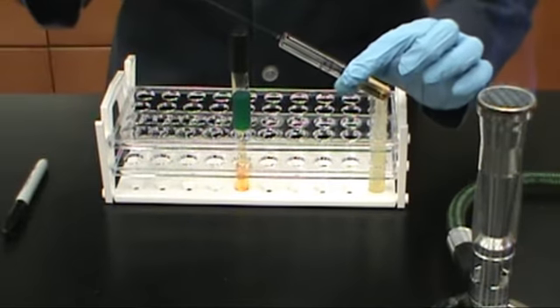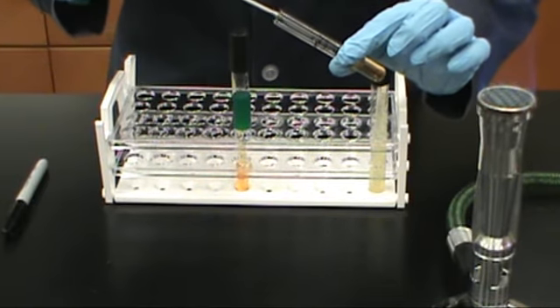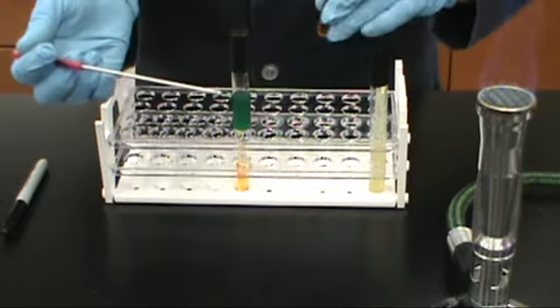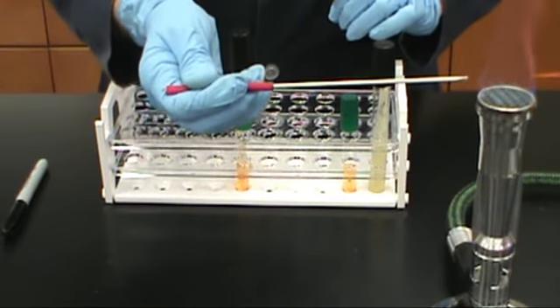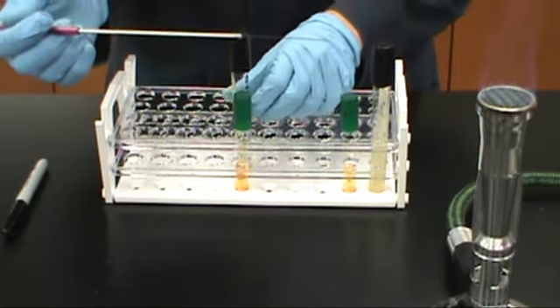Slow urease producers are not necessarily non-producers. They simply do not produce enough alkaline waste product to overcome the phosphate buffer in a 24-hour period. Many enterics are urease producers, they are simply slow urease producers. Slow urease producers are read as negative results in a urease test.